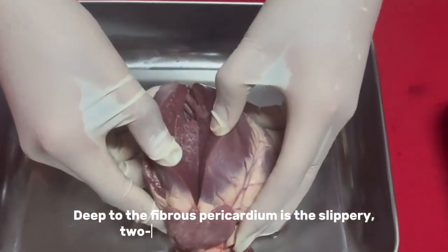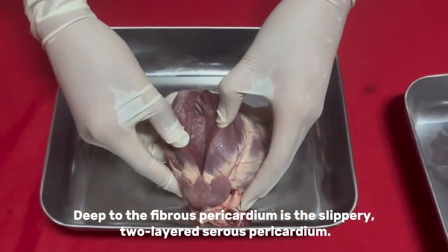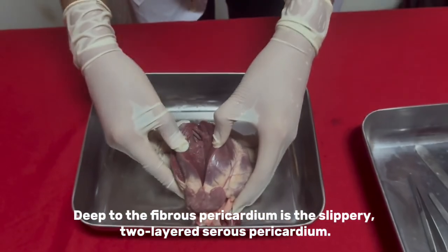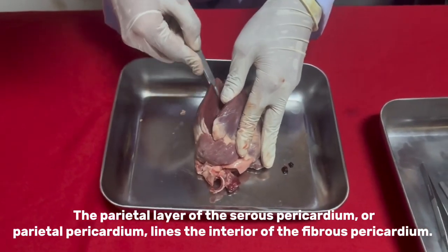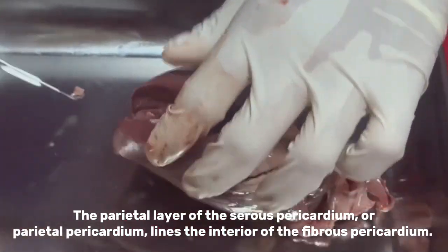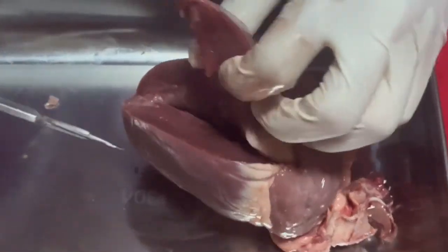Deep to the fibrous pericardium is the slippery, 2-layered serous pericardium. The parietal layer of the serous pericardium, or parietal pericardium, lines the interior of the fibrous pericardium.